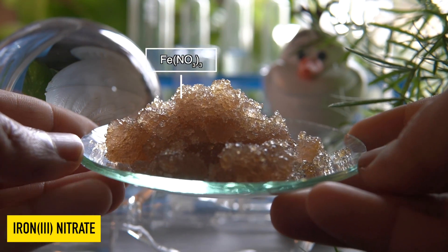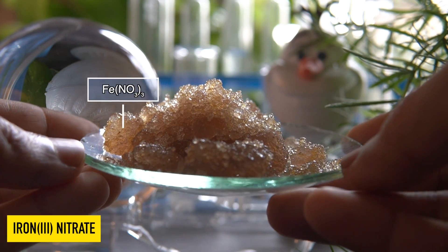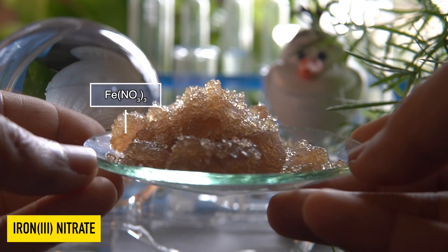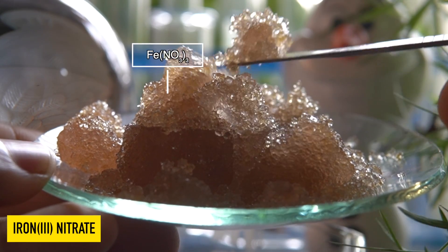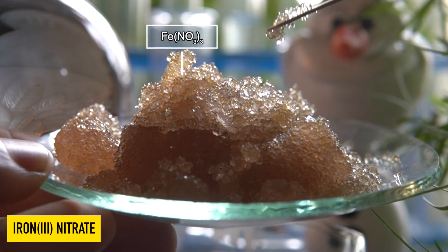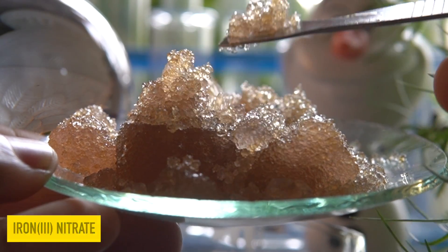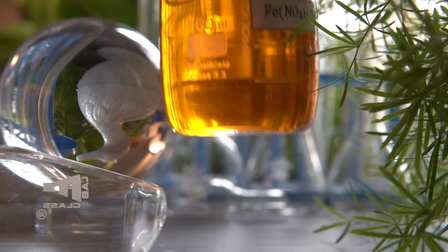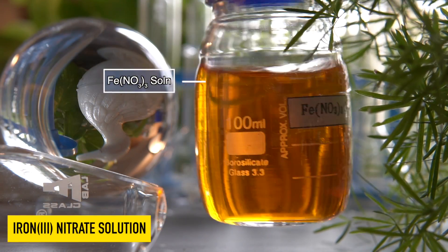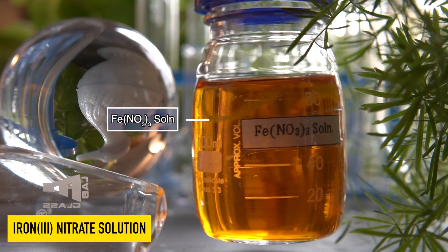This brown solid is iron 3 nitrate. It is a hygroscopic substance, meaning it can absorb moisture from air and easily dissolve in it. It is highly soluble in water.